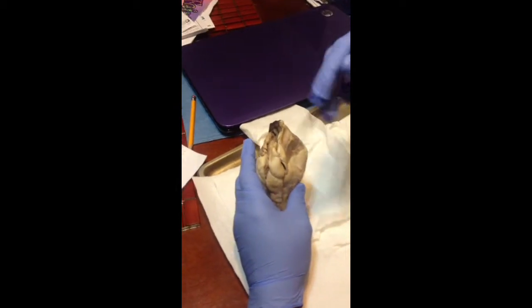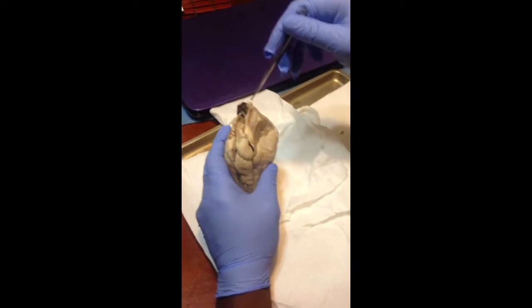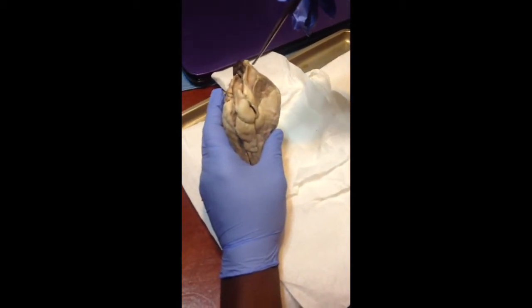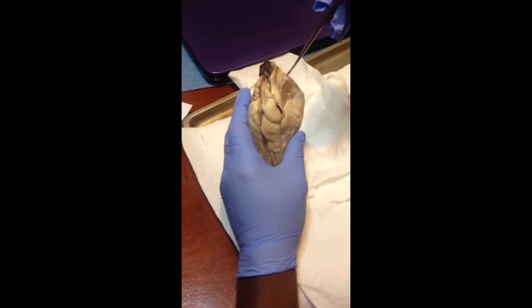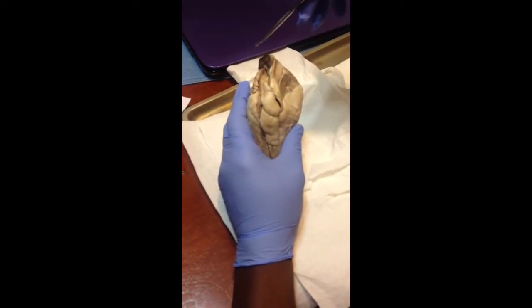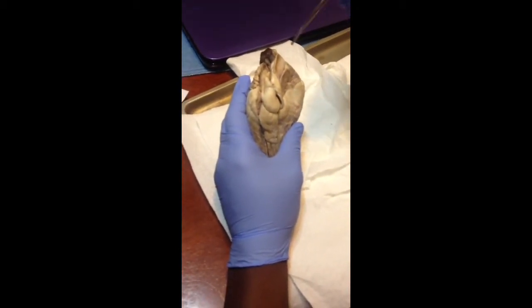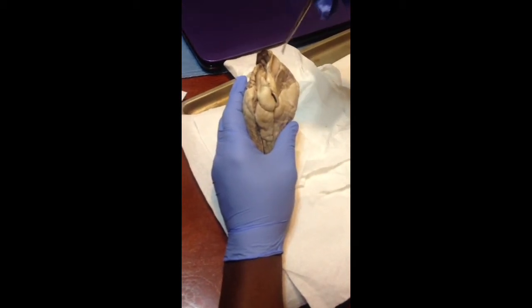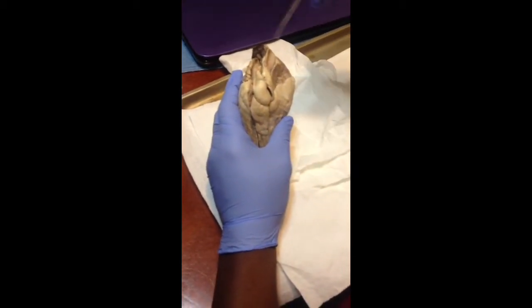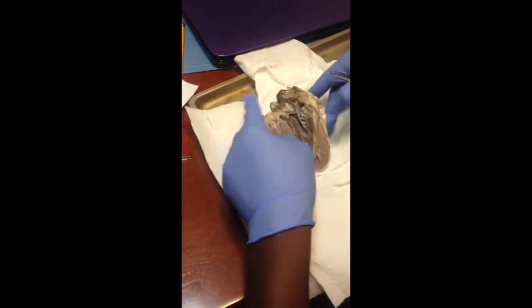The fibrous one is like a sac that lubricates the outer walls of the heart, and the other one, the parietal pericardium, is also an outer layer. The visceral pericardium is the inner wall of the pericardium. So these three are thin layers surrounding the heart. Okay, I'm going to go back in now.